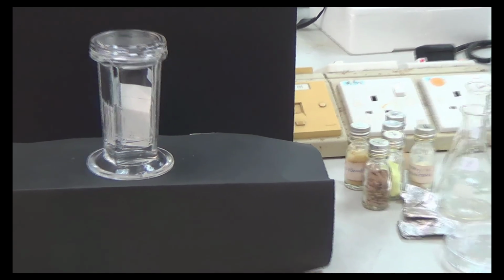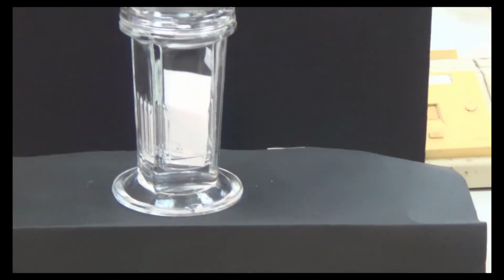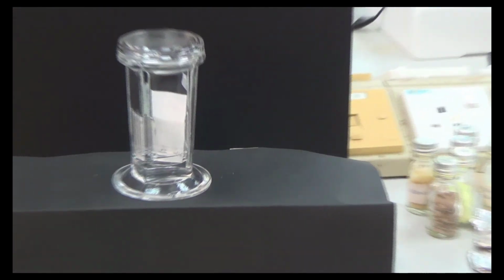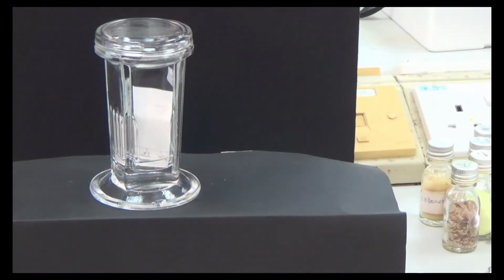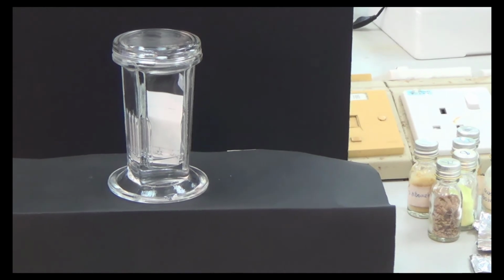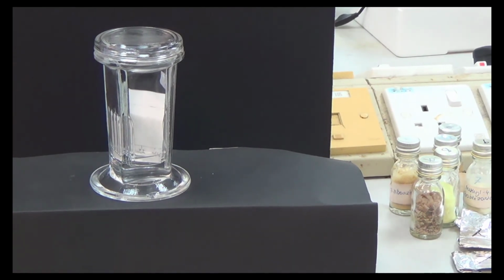So they are doing the kicking now. Wait, remove this. Now it's difficult, but I want to try to get it better. No, near is not good. You need to go far. So I think that's clear here. Okay, so now it's kicking.